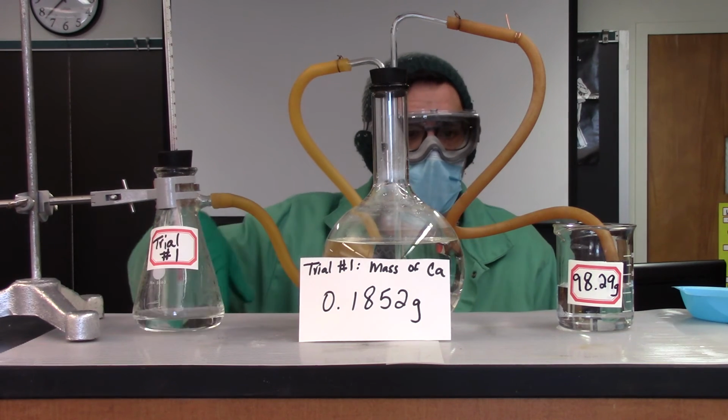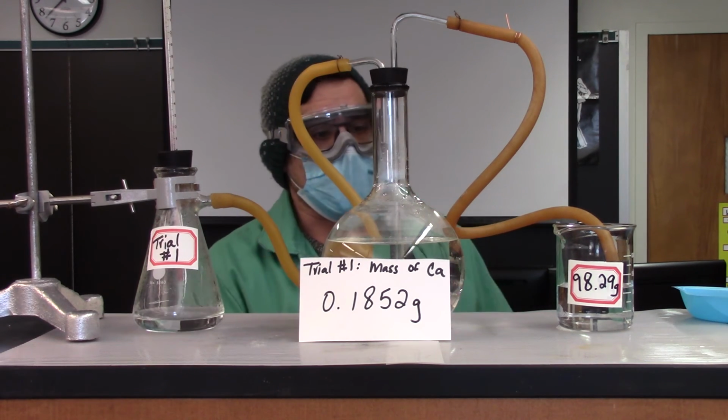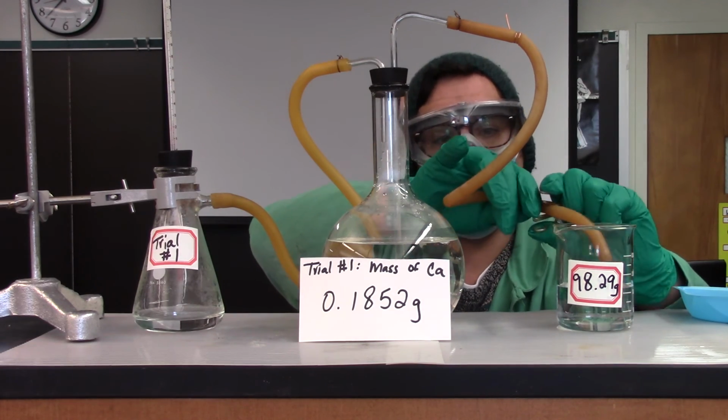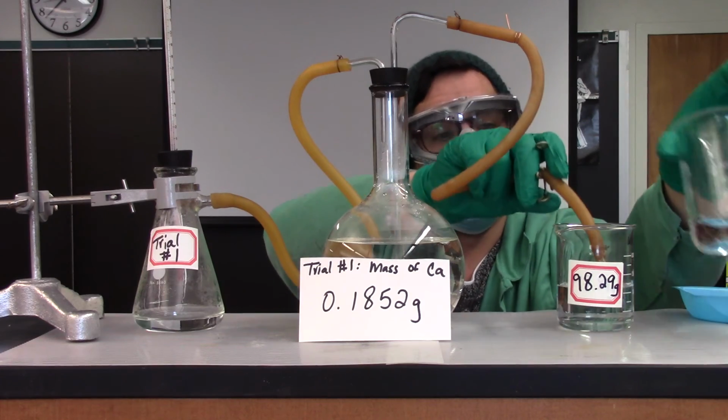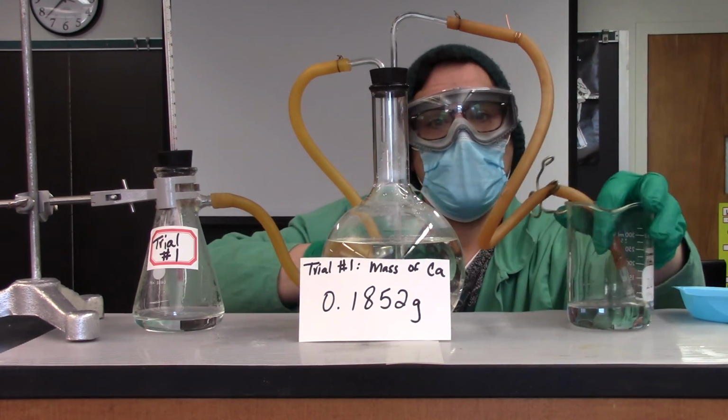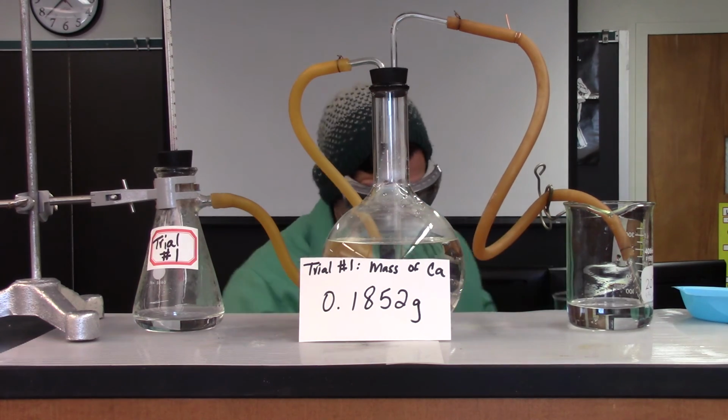And that looks like we're complete. So what I'm going to do, pinch this off, swap it back in, and now I'll mass this for you.